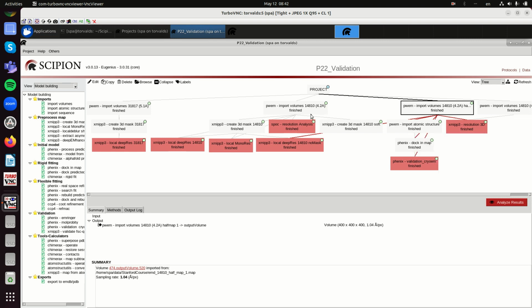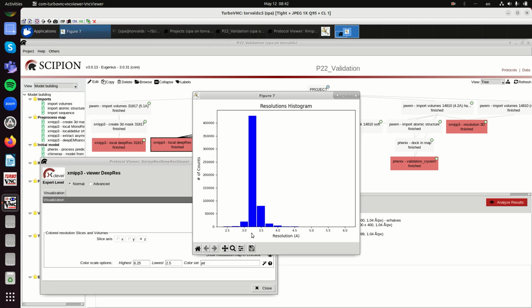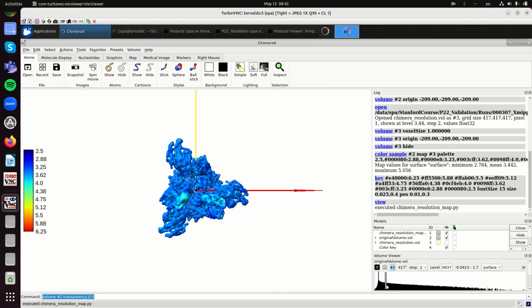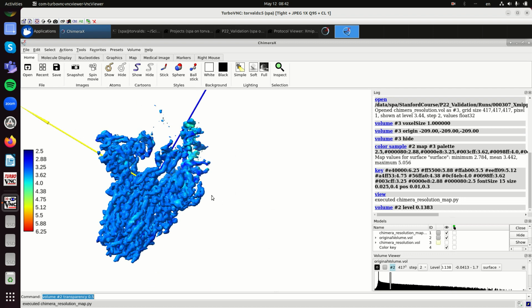Okay, so let's take the masked map, and we will analyze the local resolution with DeepRes. So the local resolution looks like this. They were claiming 4.2 angstroms. This says that it is 3.2 or 3.4 or something like that. And the reason is that DeepRes is fooled by the mask, we can see this. This is very nice. It really looks like having very sharp details, but these sharp details are caused by the masking.